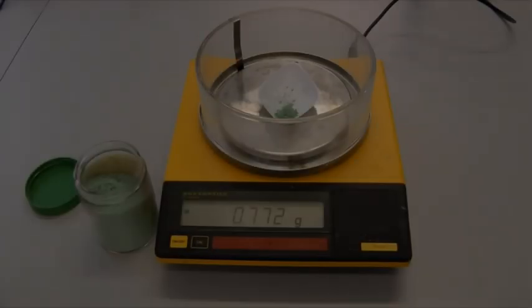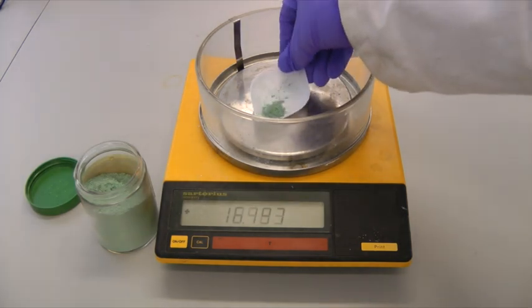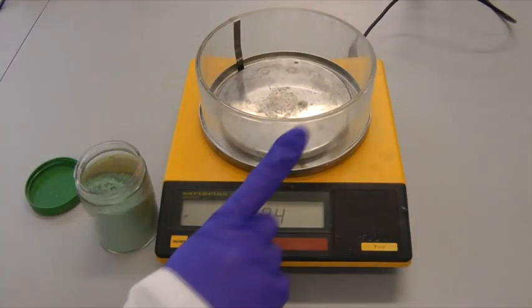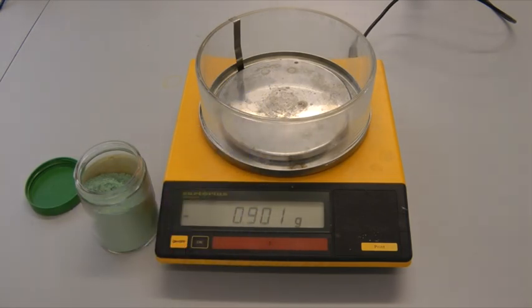If too much material is placed in the weighing boat, this must be removed. It is essential that this is disposed of properly and not returned to the original container to avoid contamination. Your teacher will give you guidance on how to dispose of any excess material.